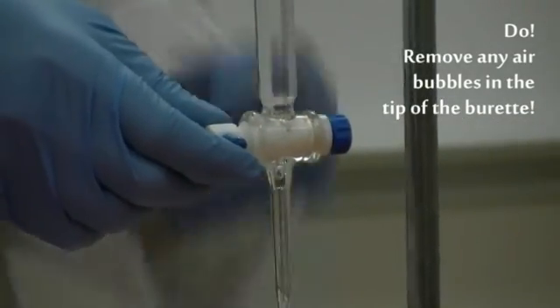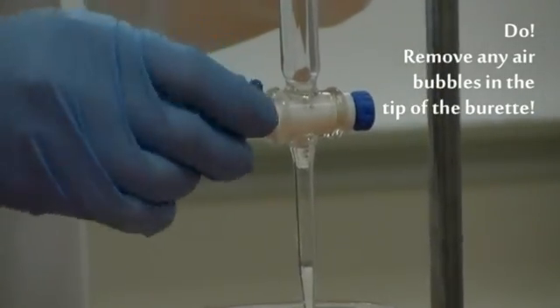Remove any air bubbles in the tip of the burette. Here's a successful technique.